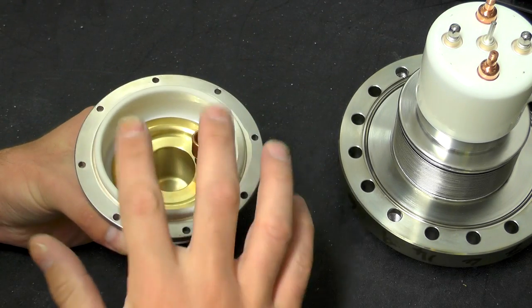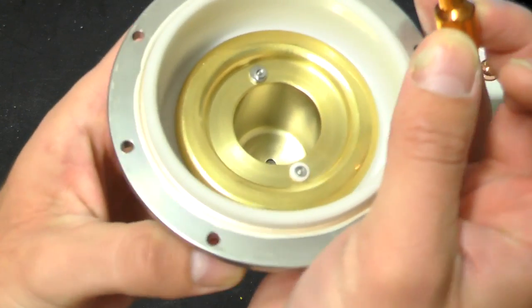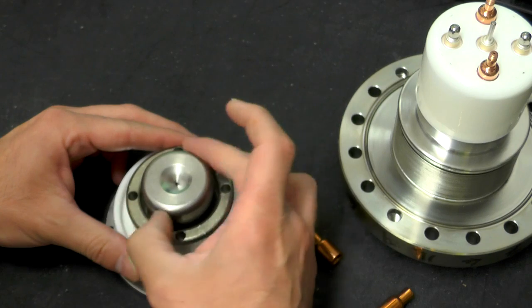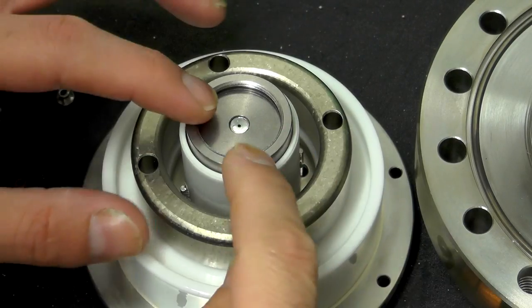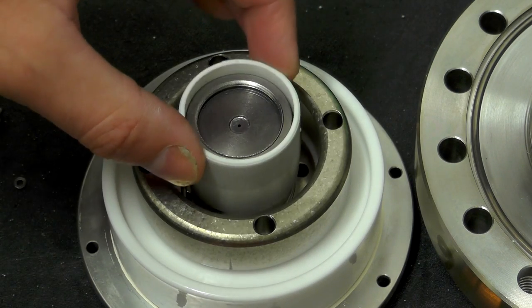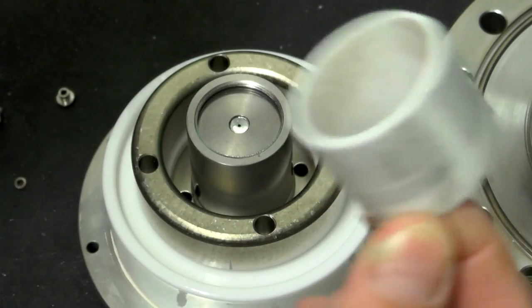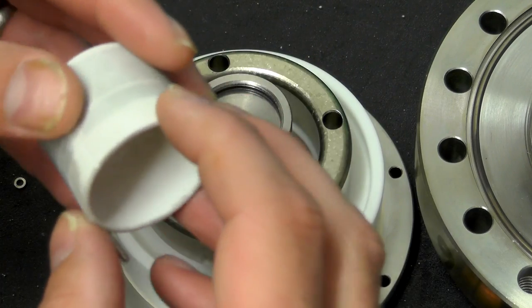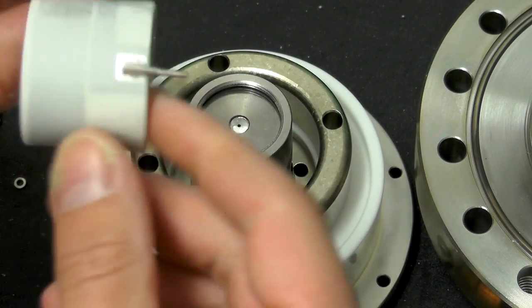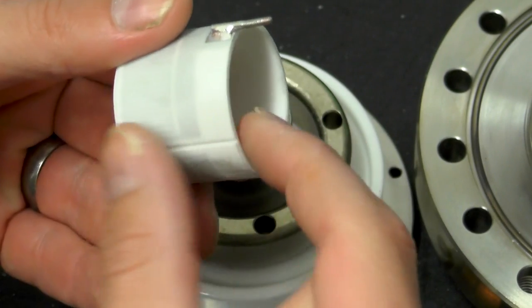So the main acceleration voltage is actually between this part here and that part in there. Now, the two connections I mentioned serving two purposes — one is insulated and one actually makes a connection to this base here. Those connections at the top went through to a ceramic heater, which is part of the baking-out system. This heats up and bakes the electron gun and all the parts around it so you can achieve a better vacuum. It's like a ceramic base — basically a large resistor — and you can see the resistive element inside measuring about 32 ohms.